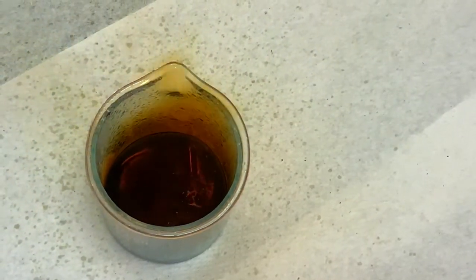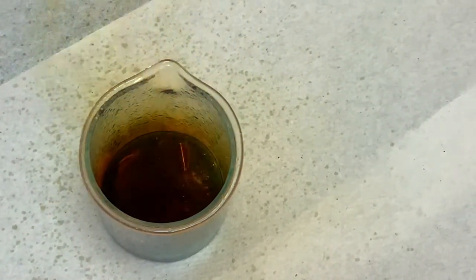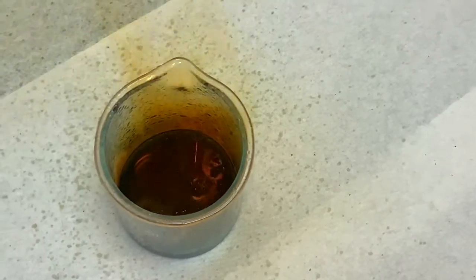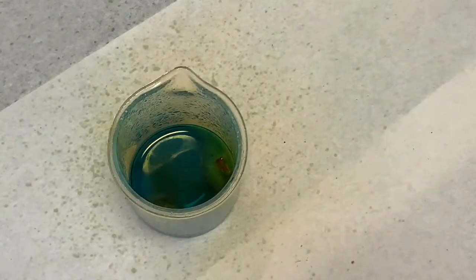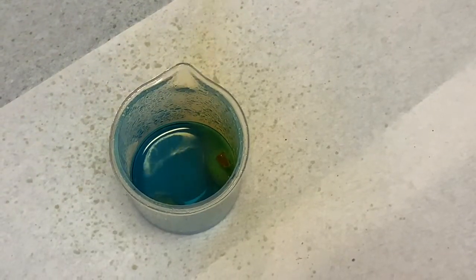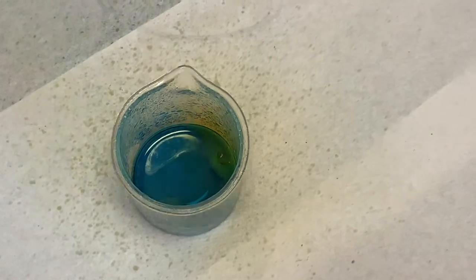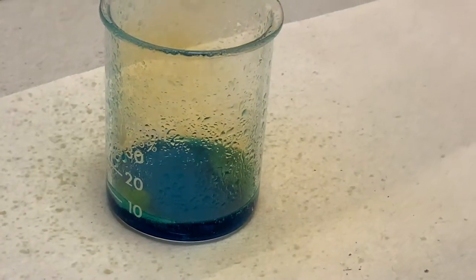You can see the shells down in the solution as more gas is evolving. This whole reaction took about 10 minutes, and you can see that the brass sample is getting smaller and smaller.